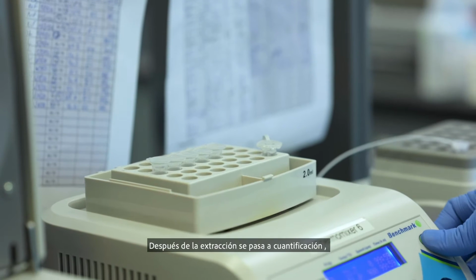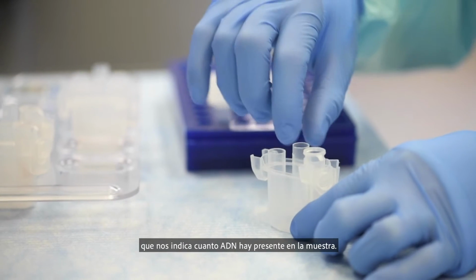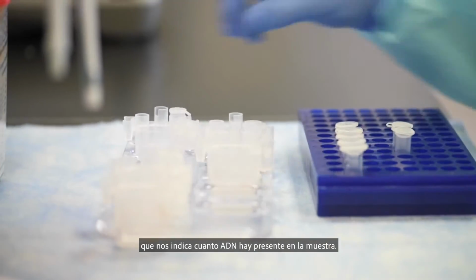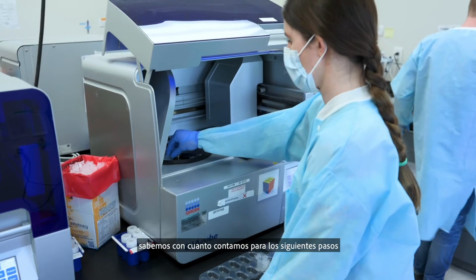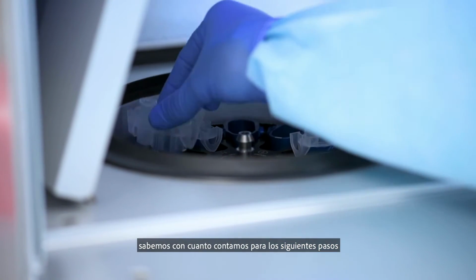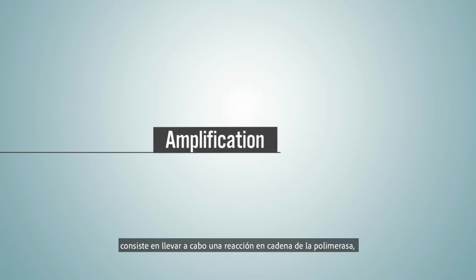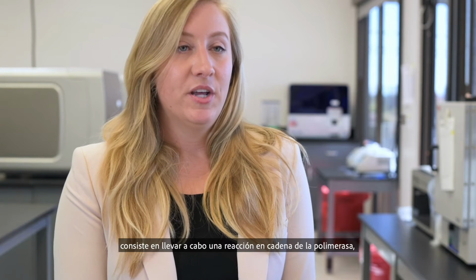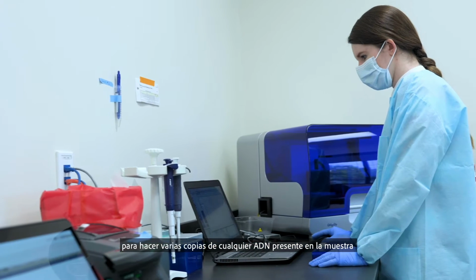After extraction, we would then go to quantitation or quantification, which would tell us how much DNA is present in that sample. Once we know how much DNA is present, we then know how much we should target for the following steps. The next step would be amplification, which is using polymerase chain reaction to make many copies of any DNA that may be present in the sample.